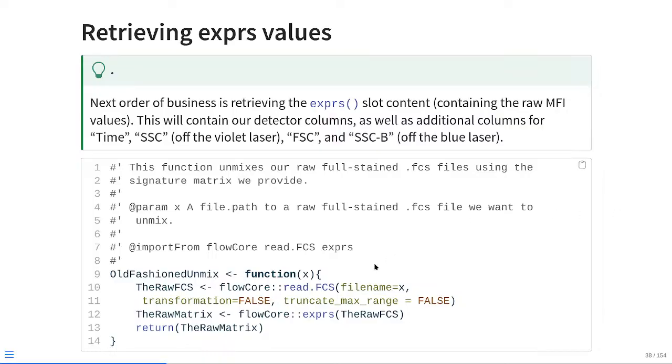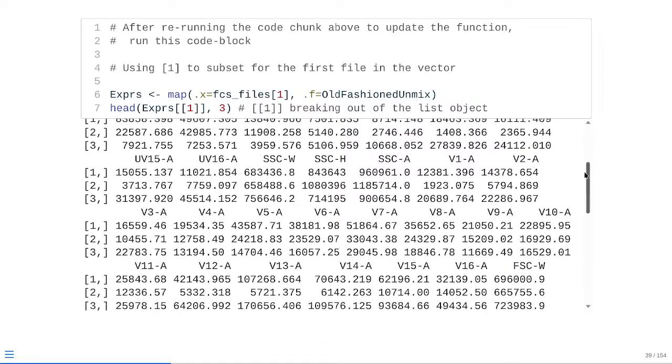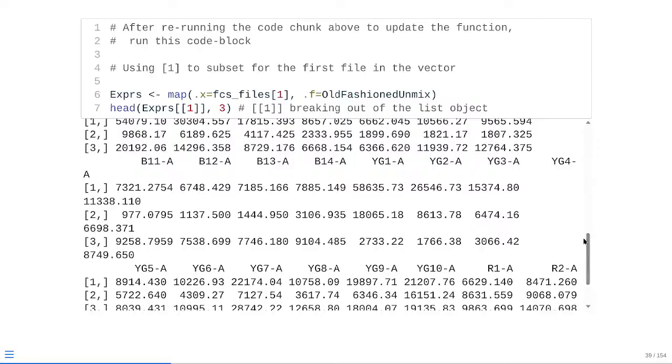So to actually go ahead and update our function, we're taking that little intermediate we had, the raw FCS, and we're going to pass it to grab the internal exprs slot. That would be the exprs helper function from the flowCore package, which will access it, grab it, retrieve it, saving us all the hassle of adding all those little @ signs. And then at that point, we're creating a new object called raw_matrix, which we're switching out for the raw FCS that had been in the return, so that instead we're now getting back the raw matrix. At that point, refresh the function, rerun the output line, and as you can see, we're getting back the raw values corresponding to those designated detector columns, as well as time, side scatter, forward scatter, etc.